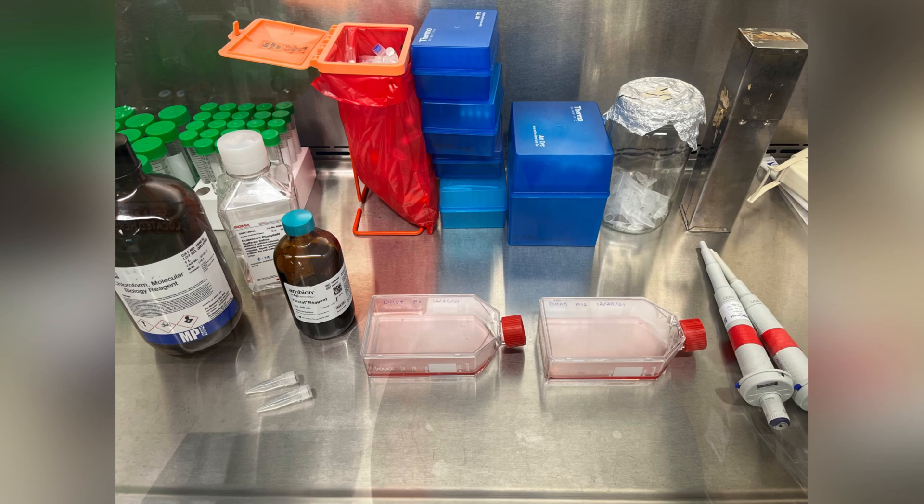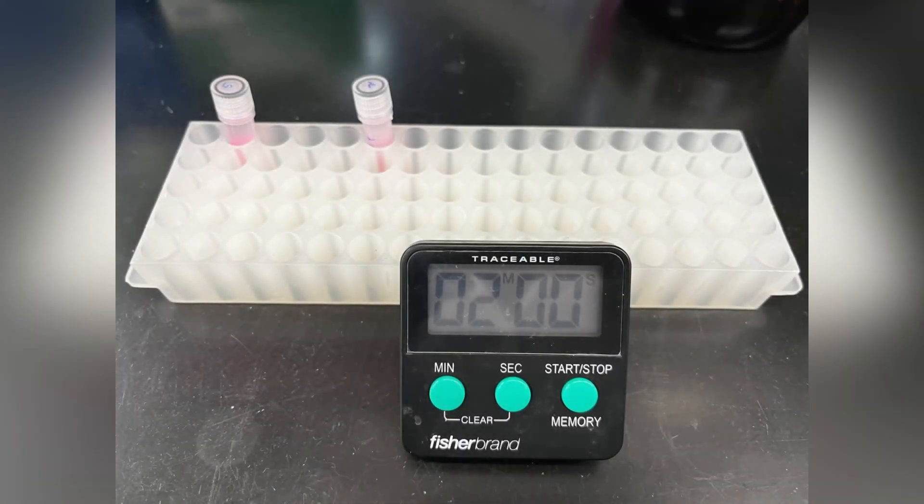Then add 200 microliters of chloroform to it under the hood and shake it for 15 seconds vigorously. Incubate it at room temperature for 2 to 3 minutes.